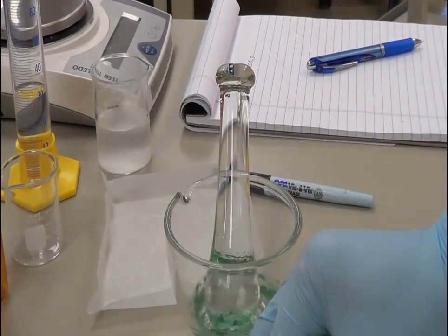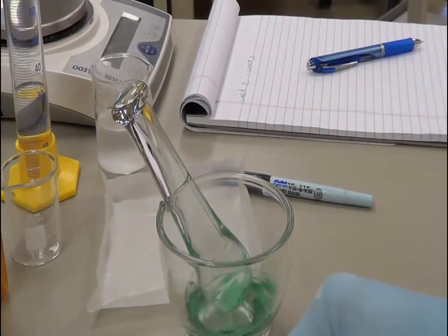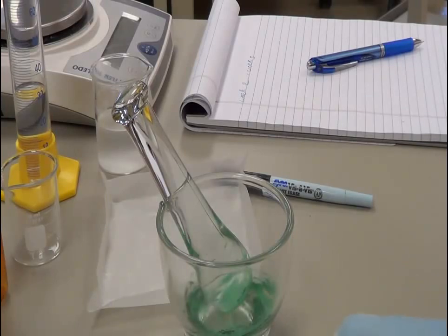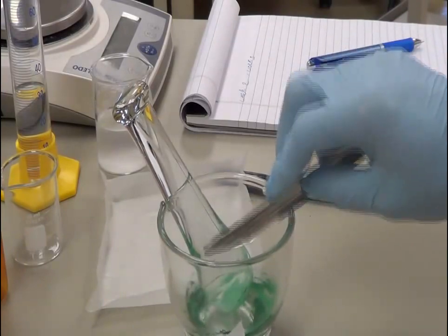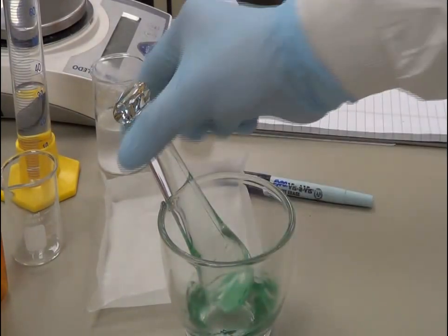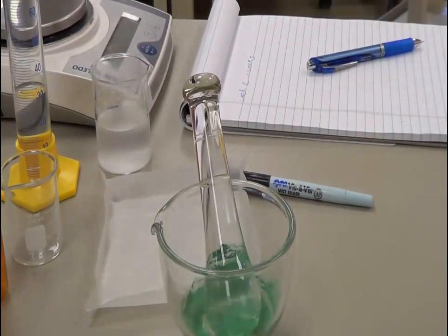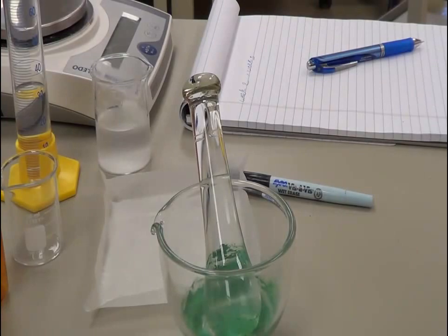I am going to triturate again. After some more time, let's add the leftover — approximately 16 milligrams more. I am triturating again and finally adding the leftover ascorbic acid.